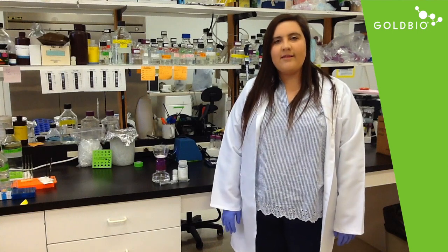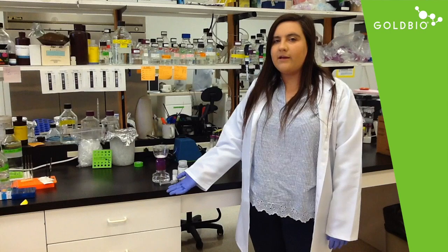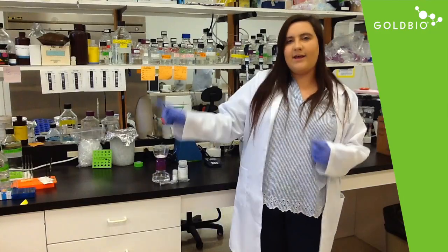The best thing about these products is that they come with our antibiotics pre-measured and include filtration mechanisms to make a sterile stock solution. If you want to learn how to make the sterile stock solution, then let's go ahead and get started.